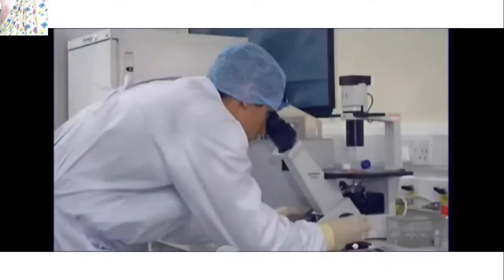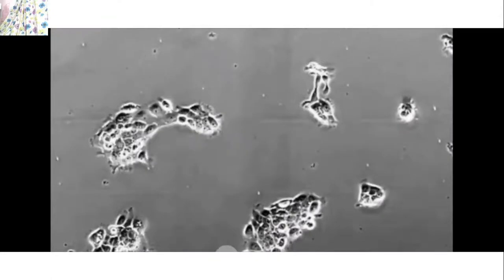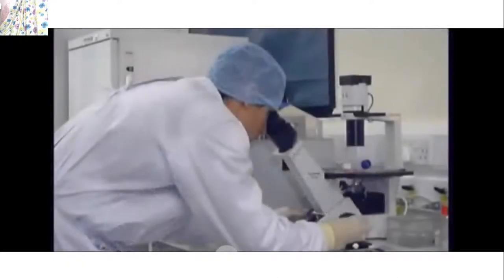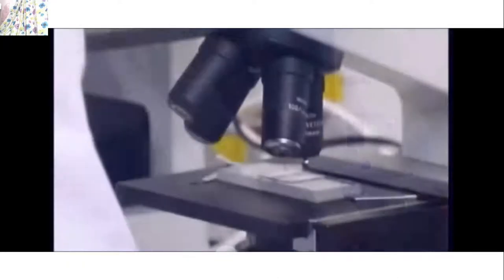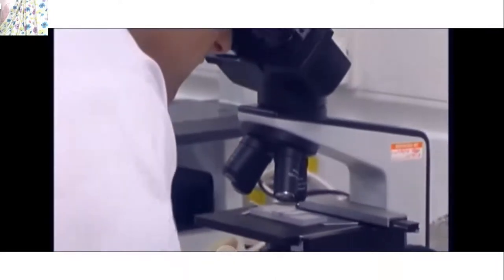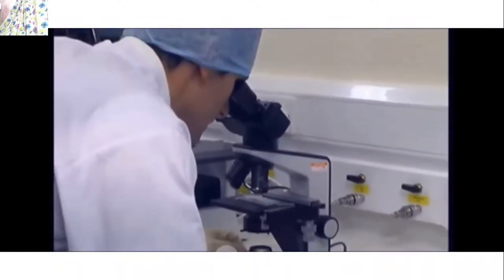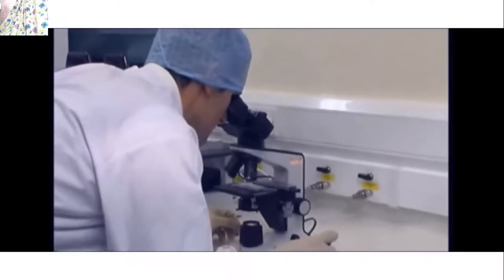Regular monitoring of cell cultures is essential as it provides information regarding cell growth and general health of cultures. A properly set up inverted phase microscope is required, and a standard light microscope is also useful for applications such as cell counting. Microscopes are precision instruments and should be well looked after — always turn off and cover when not in use.